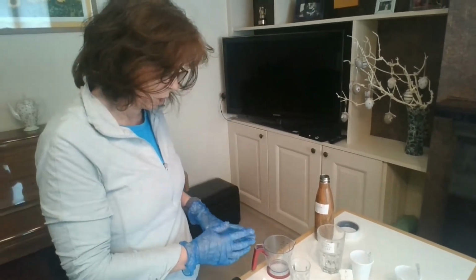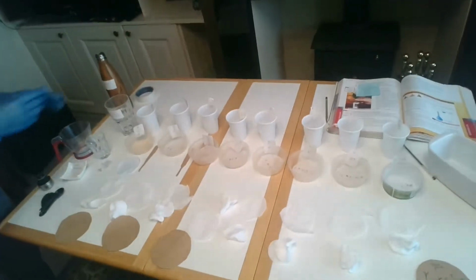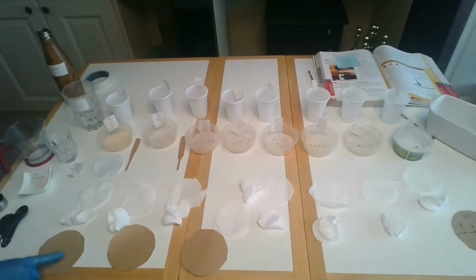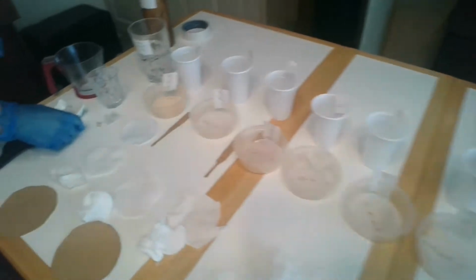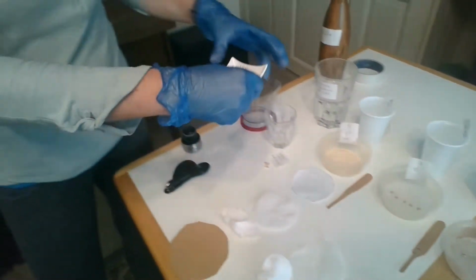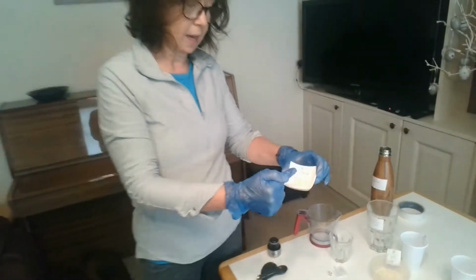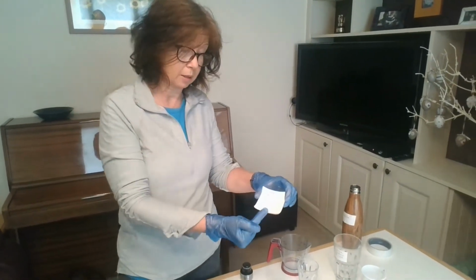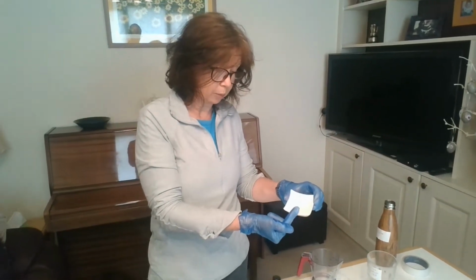So I'm going to set up a series of dilutions, and I've set up my experiment here with my own version of Petri dishes and bottles and filter paper, cotton wool and lids of Petri dishes. So just go with me on this one. Okay, the first thing I have to do is I have to make up a stock solution of IAA. And when I say I, I mean the teacher. And I'm wearing gloves because IAA is toxic. So your teacher would always set this up.